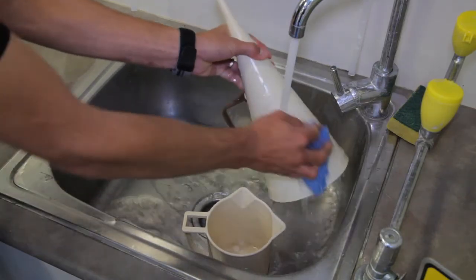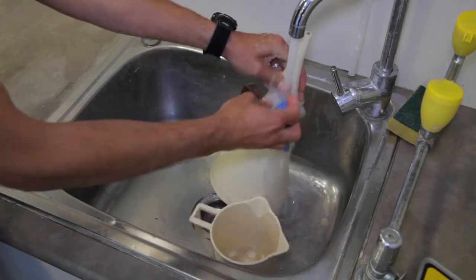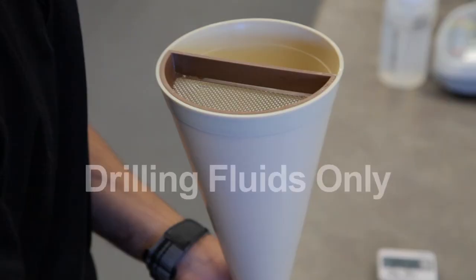It's recommended that the funnel and cup be cleaned after each test to ensure the results are accurate. The funnel is designed for drilling fluids only, and not to be used for fuel, oil or any other substance.